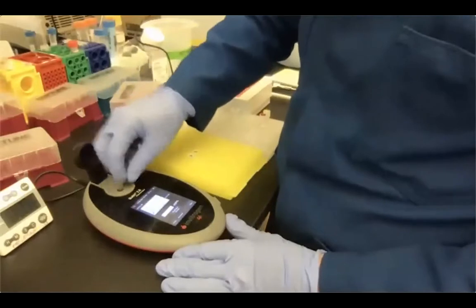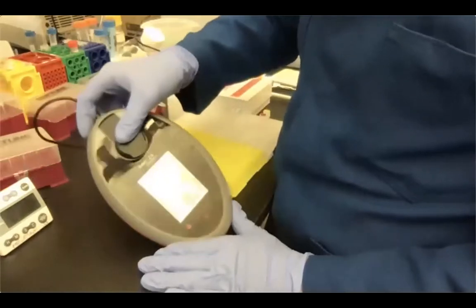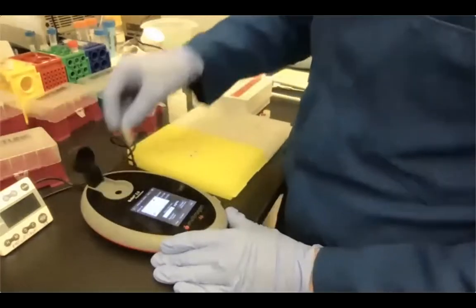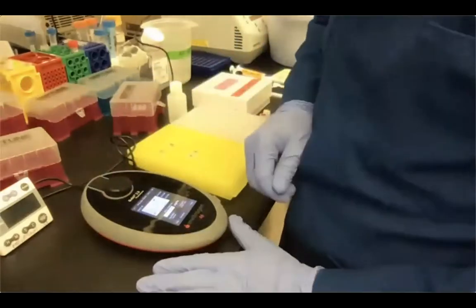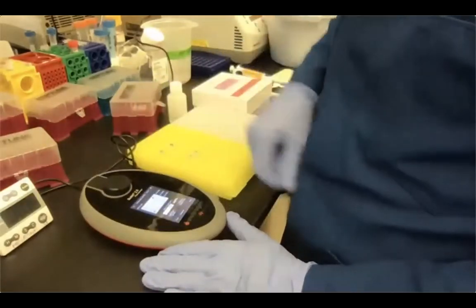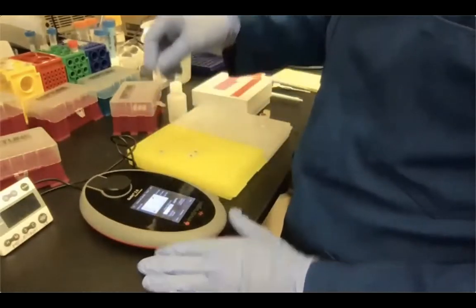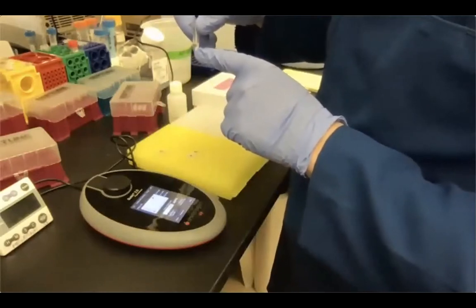And then we're going to insert standard 2 and reread it as if it were an assay tube. And now you have a very high concentration. So it's about 5, okay? So micrograms per ml, okay? So if you want to calculate the concentration of your actual sample, the concentration that appears here on the screen is actually the concentration of your diluted tube. Remember, we've added 10 microliters in 200 microliters of assay volume.